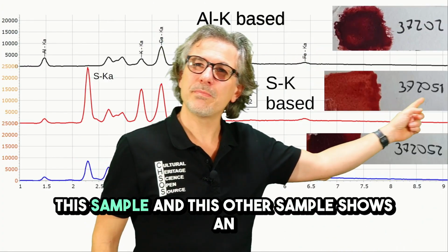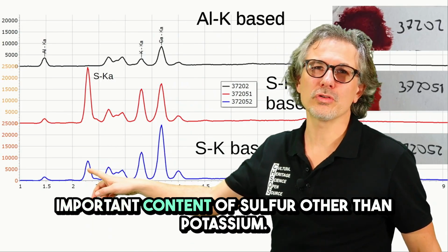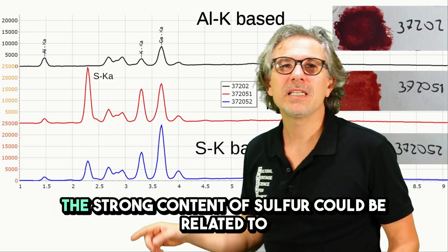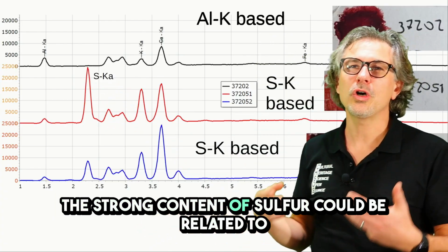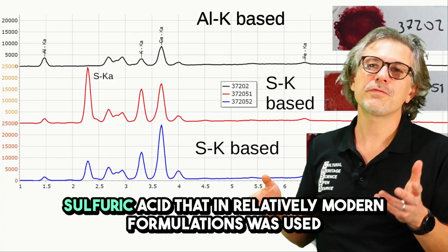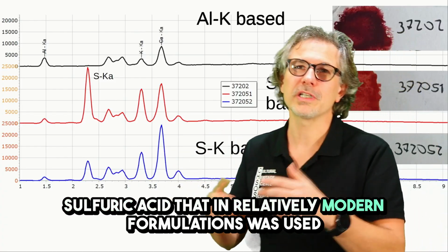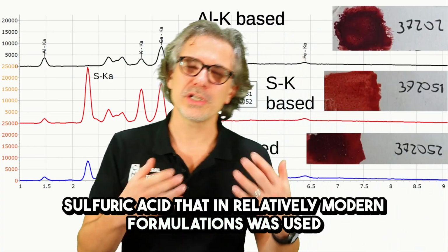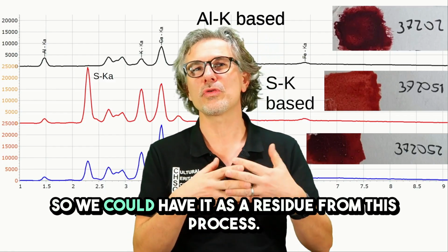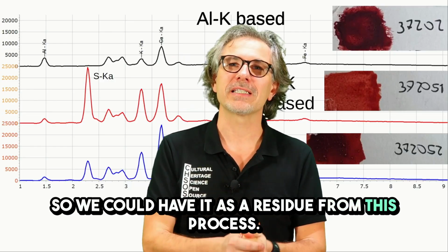This sample and this other sample show an important content of sulfur, other than potassium. The strong content of sulfur could be related to sulfuric acid that in relatively modern formulations was used to enhance the extraction of the colorant, so we could have it as a residue from this process.